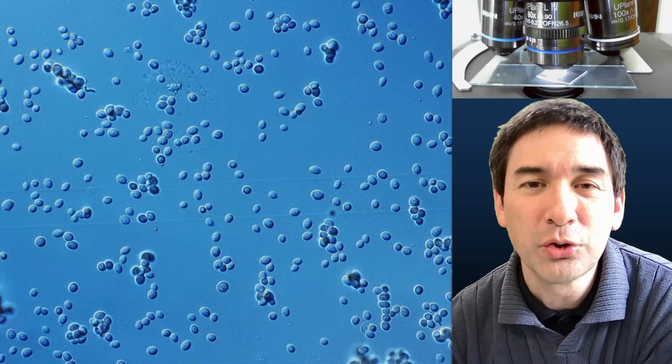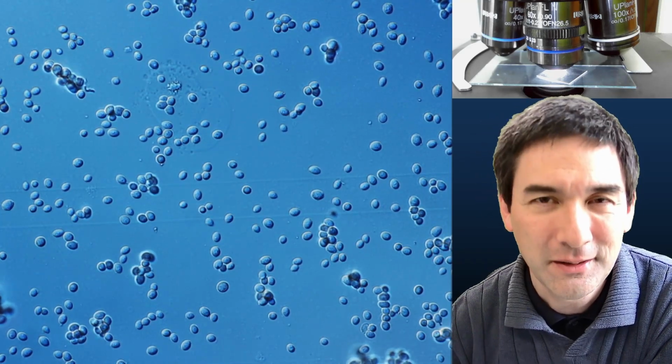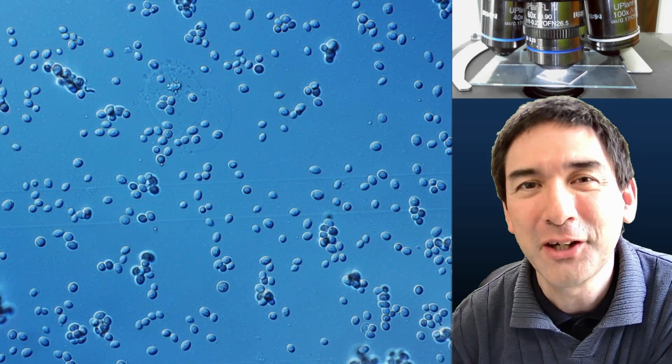So I just wanted to show you a little bit. Old cultures, they're not good anymore. They started to decompose, and then all of the cells start to die off. I just wanted to share that with you.